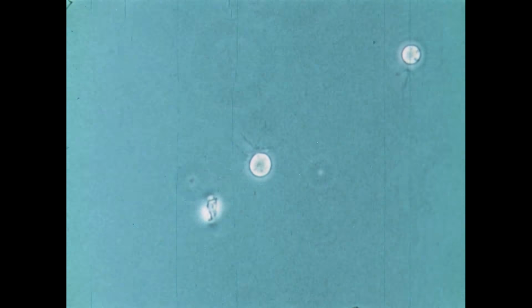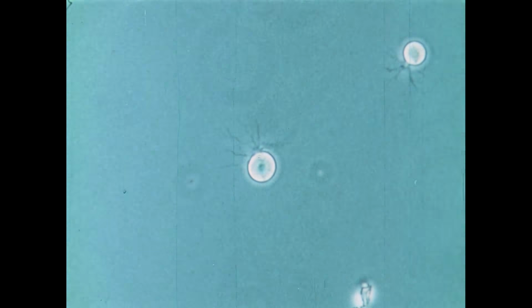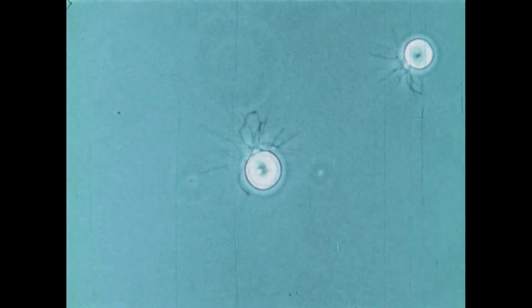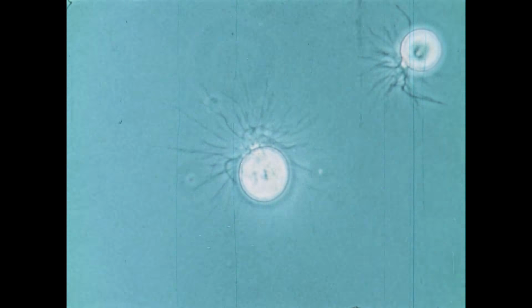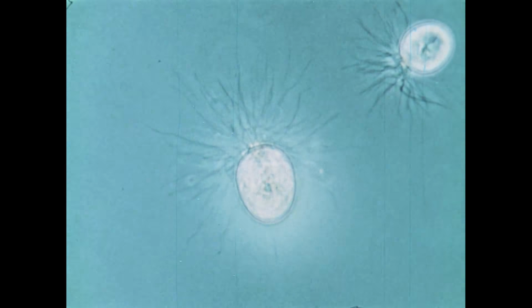For about a day, the cell will grow exponentially. The original spore nucleus will reproduce to yield many additional nuclei embedded in a common cytoplasm. When growth stops, the cell differentiates a multinucleate sporangium in which each nucleus will be incorporated into a zoospore.